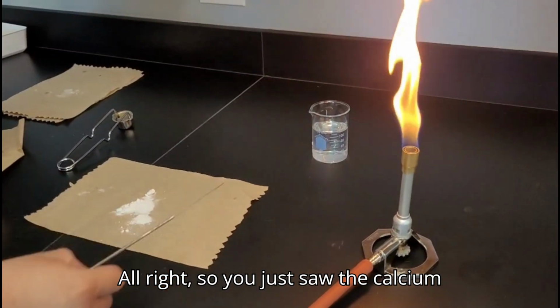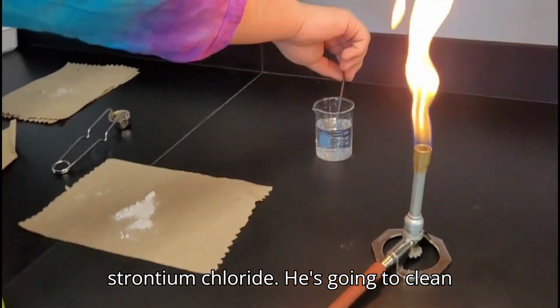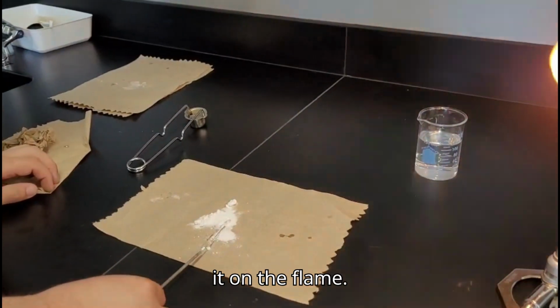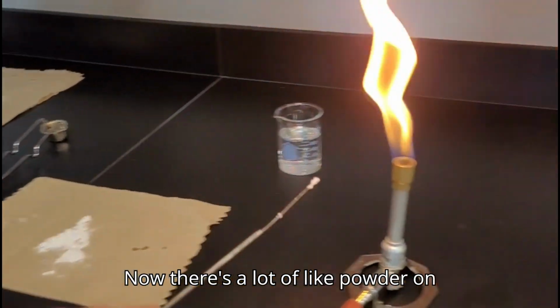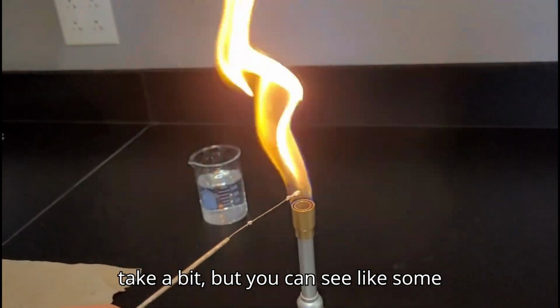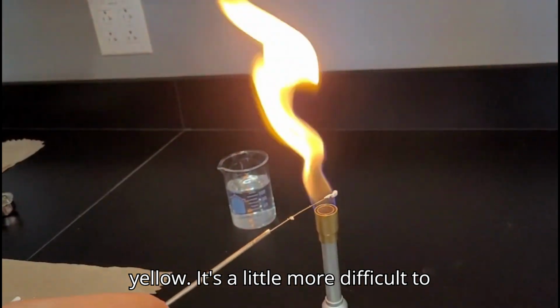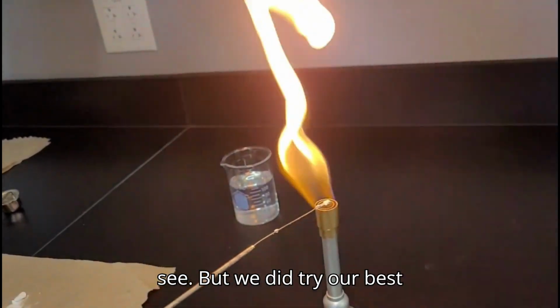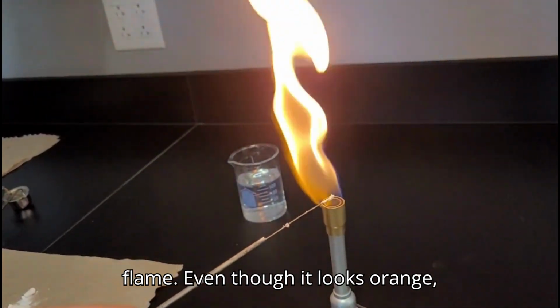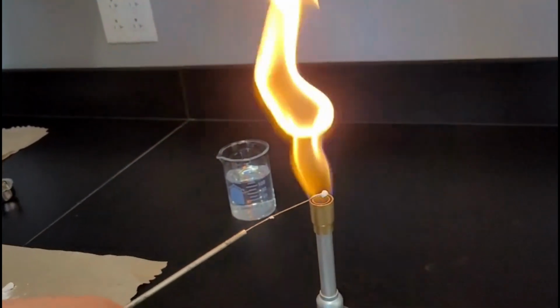Alright, so you just saw the calcium chloride. Now you'll be seeing the strontium chloride. He's gonna clean it, dip it in, put it on the flame. Now there's a lot of powder on it, so it might take a bit, but you can see some yellow. It's a little more difficult to see, but we did try our best, and it kind of changed the color of the flame. Even though it looks orange, yellow is very close to that same color.